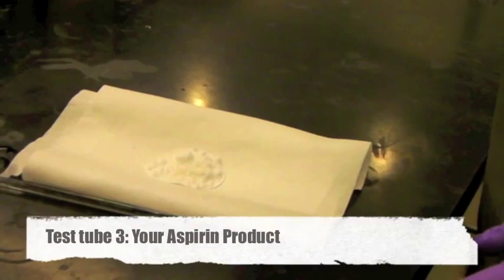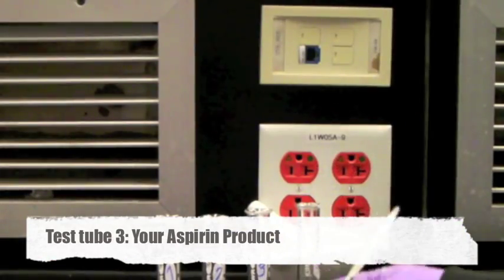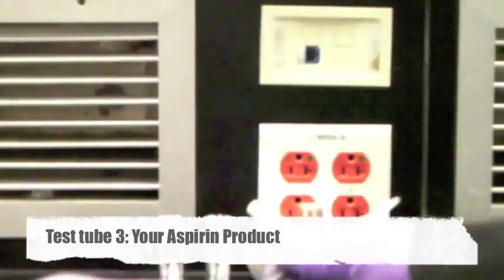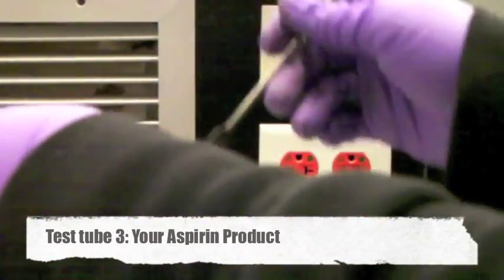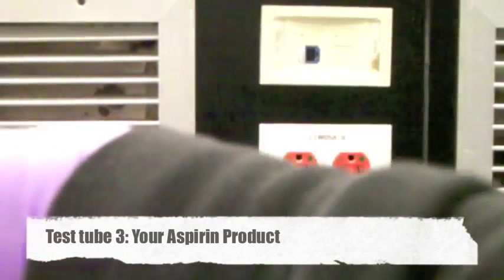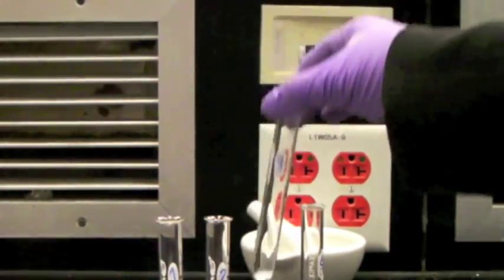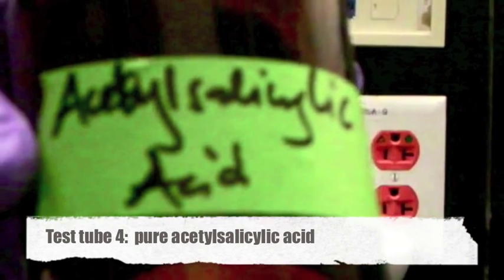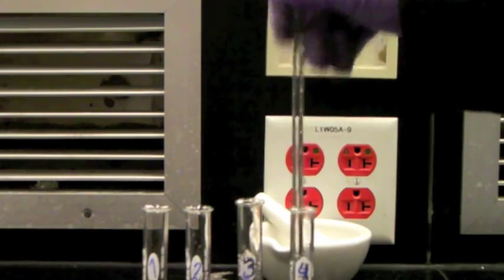Use a little bit of your aspirin product and dissolve it with 3 ml of DI water in test tube 3. Dissolve a little bit of pure acetylsalicylic acid with 3 ml of DI water in test tube 4.